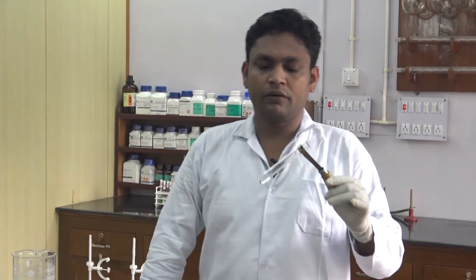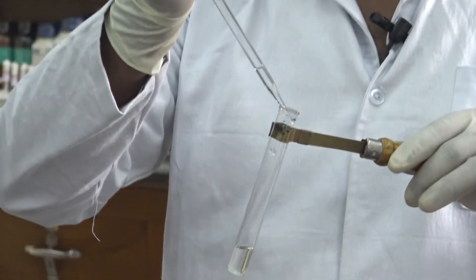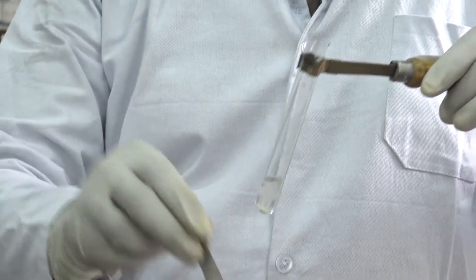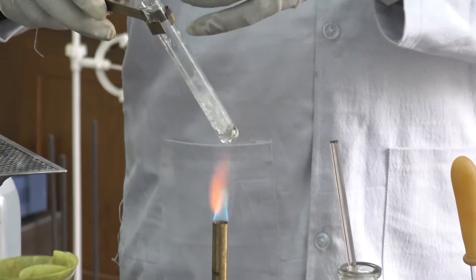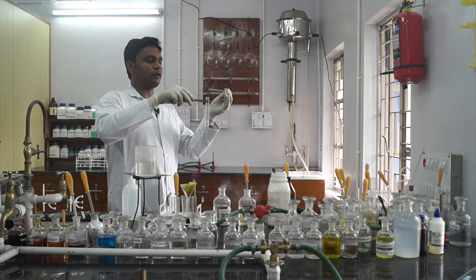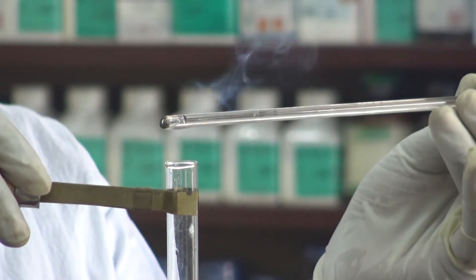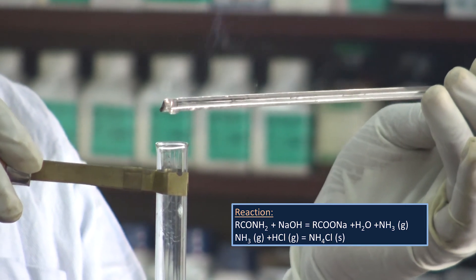Now we will test for the amide group. For this test, we need the sample, NaOH solution, and concentrated HCl on a glass rod. At first, we take NaOH solution in a test tube, then add the sample into the NaOH and heat it over a Bunsen burner. Here we can see that white fumes with the smell of ammonia evaporate. When a glass rod dipped in concentrated HCl is held at the mouth of the tube, it produces white fumes of ammonium chloride, indicating and confirming the presence of the amide group in our organic compound.